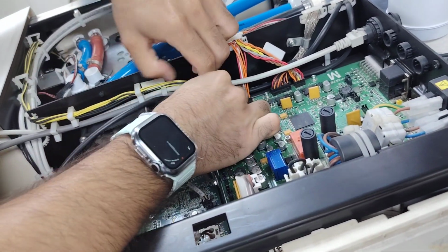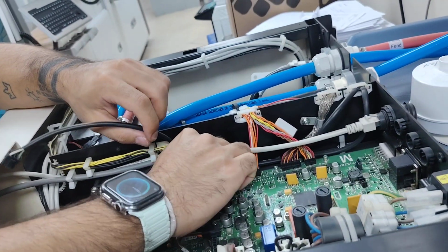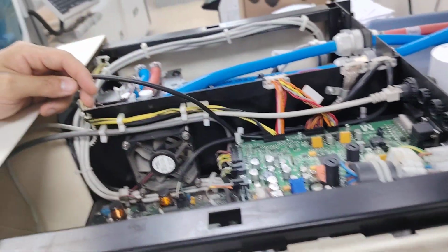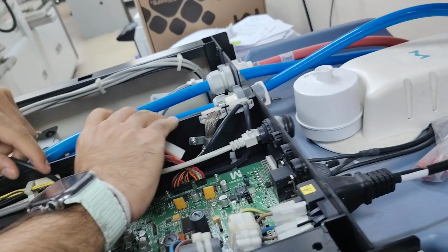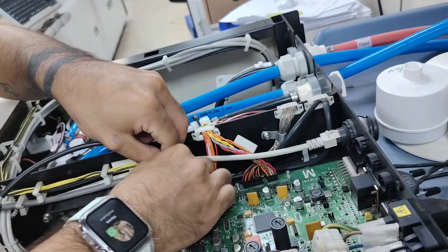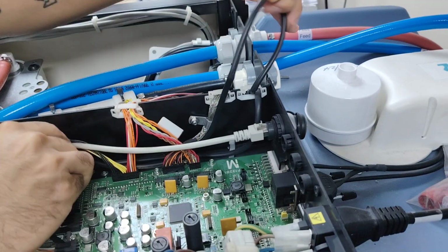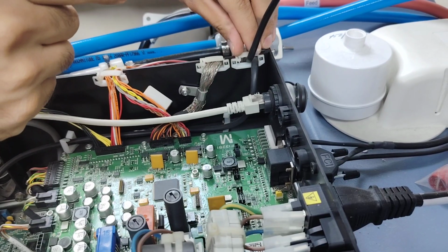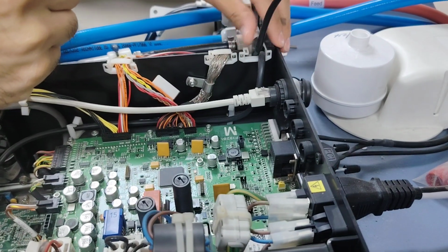This one, is there a UV light or no? The small one. No, I think no. Long time we did not. No, this is no, but it has EDI. This is 230, the other one 260. Okay, not too much at all. It's almost there. That's all there.